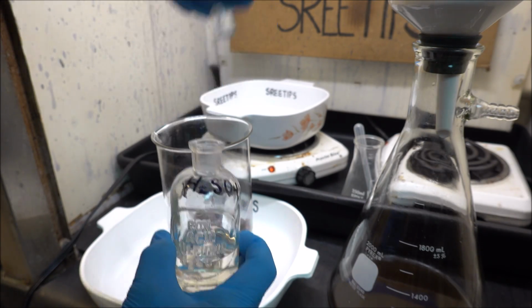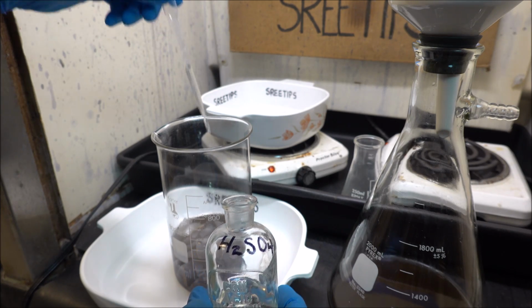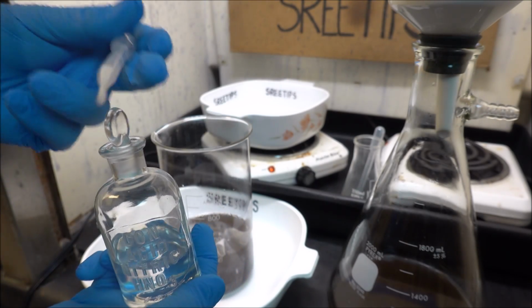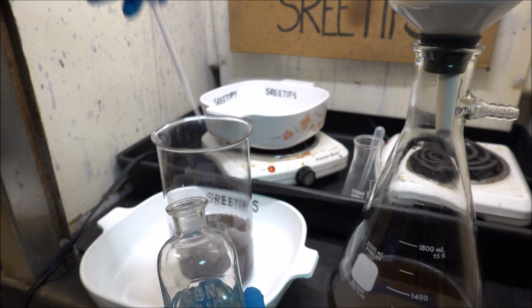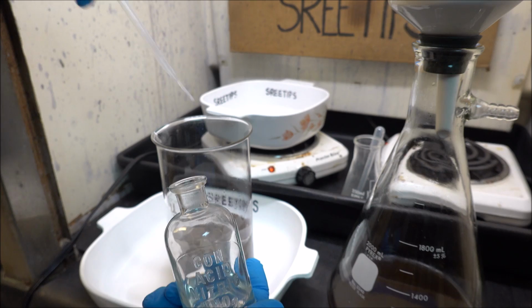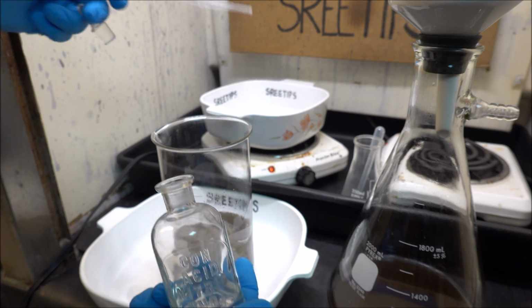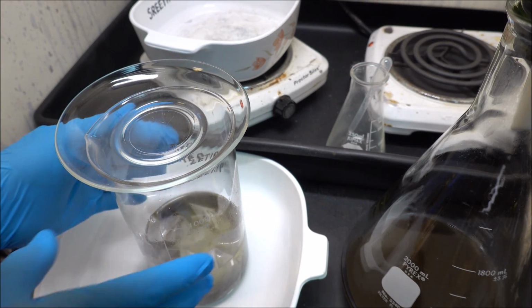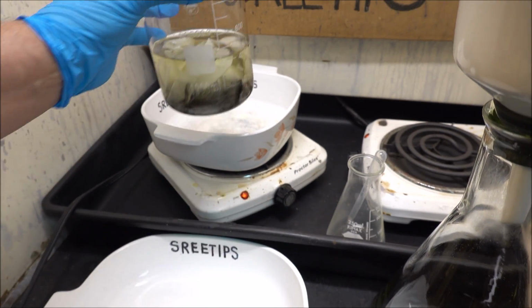As usual, I'm going to add some concentrated sulfuric acid here just in case there's some lead in there. That's about 1.5 milliliters of concentrated sulfuric acid. I'm going to add some concentrated nitric acid here to form aqua regia. That's going to be about 24 milliliters of concentrated nitric acid. Cover this up, give it a little swirl to mix it up, and we're going to put it up on the heat here and let it dissolve.